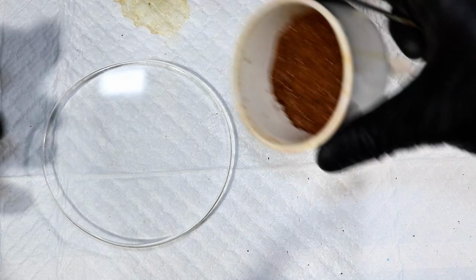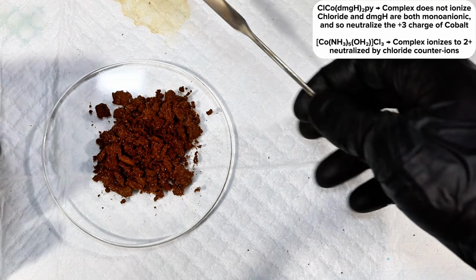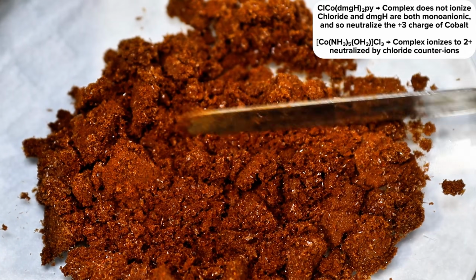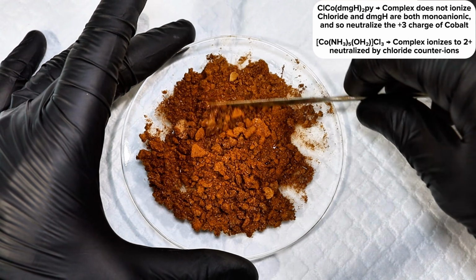The big difference between this complex and my first one is that this complex is electrically neutral and much more covalent in structure. As a result, no counterions are necessary to stabilize the final complex, and so this chemical is much less soluble in water or other polar solvents. In fact, this chemical can be recrystallized from a hot mixture of ethanol and ethyl acetate, which is unusual for a metal-containing molecule.